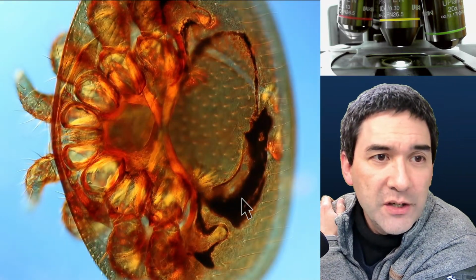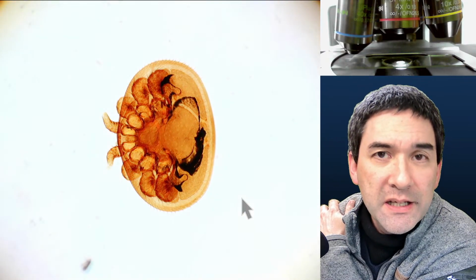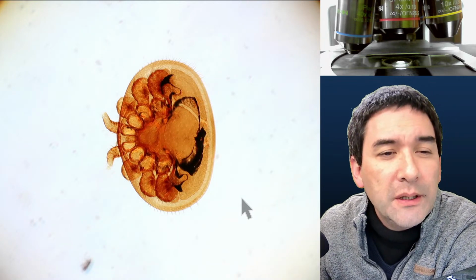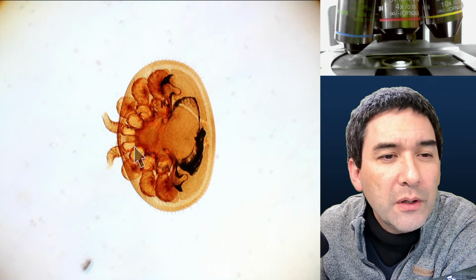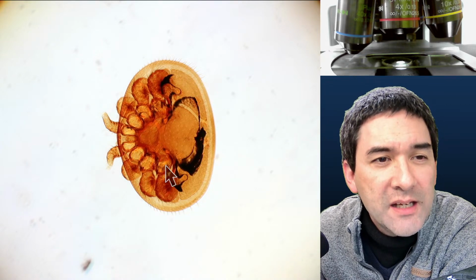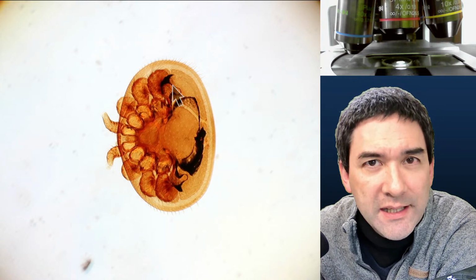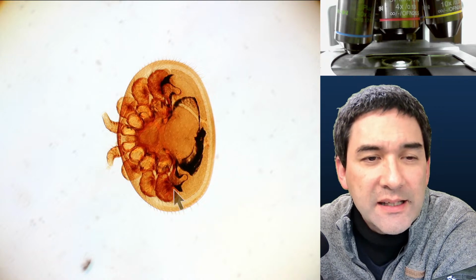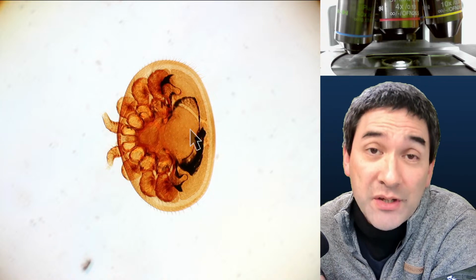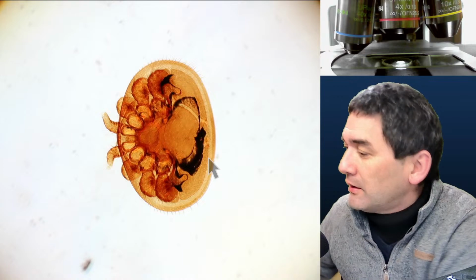I've also made videos of this already. That's a very problematic one, especially for bees, because it's a parasite of bees. And if we look at it, you can actually see that you have got 1, 2, 3, 4 pairs of legs. So basically there are 8 legs. Just like the spiders have 8 legs, those mites and ticks also have 8 legs, and that's an important distinguishing criterion between insects and spiders and ticks, and of course no wings present either. Okay, so that is essentially the mite.